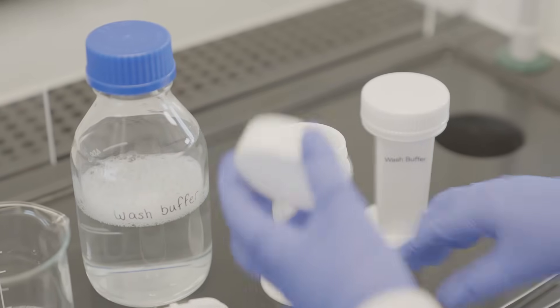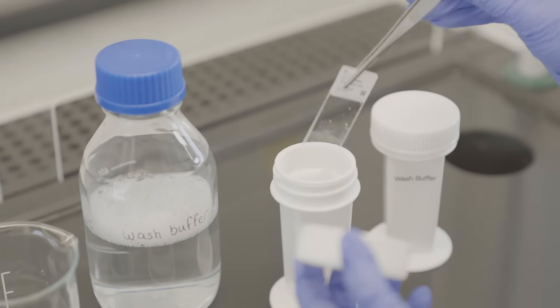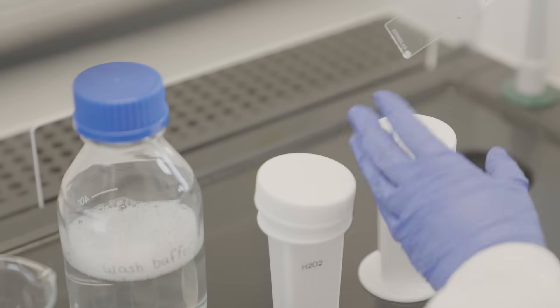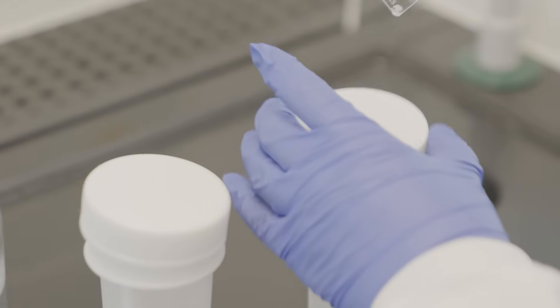Wash slides three times with wash buffer for three minutes each. Then rinse slides three times with distilled water for three minutes each.